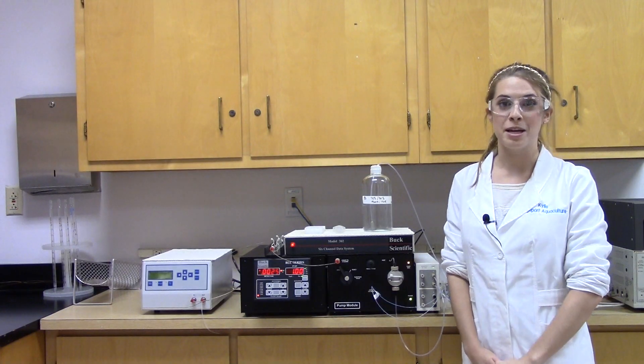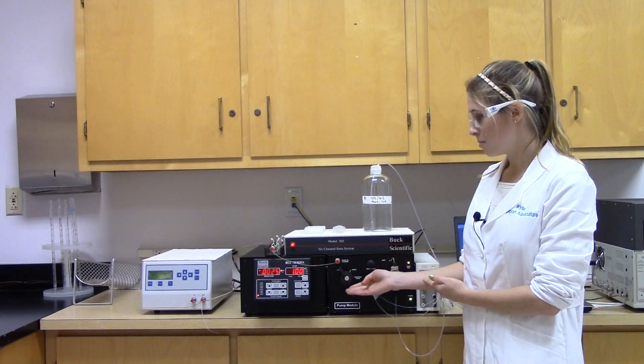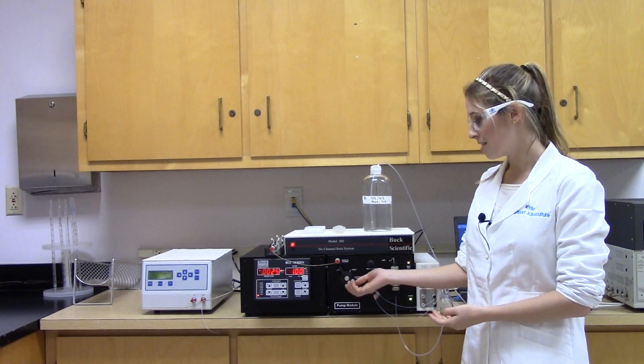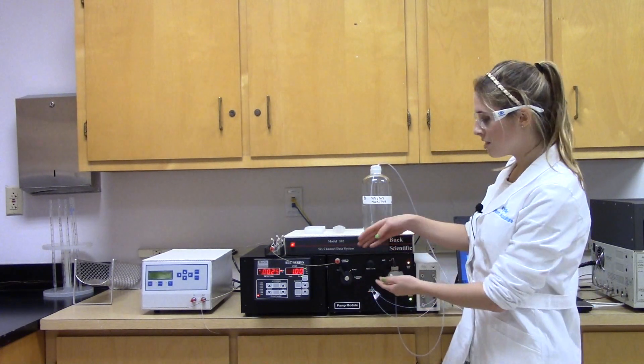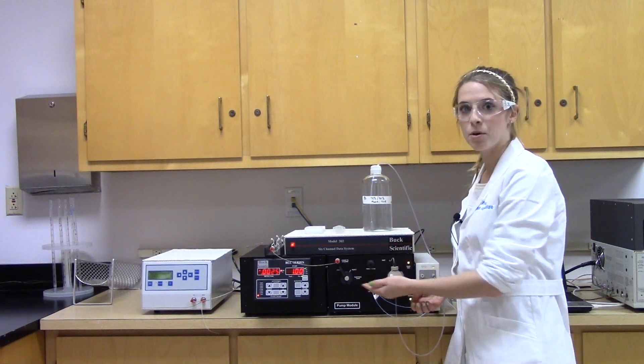So in order to run the sample, when injecting, the position always has to be on load. Occasionally, a common mistake students make is by having this still be an inject. If this is inject and students add the sample, that causes problems. At least that's what we think. Luckily, we have John Miller here today, production manager of Buck Scientific. John, what would happen if we inject our sample while it's in the inject position?